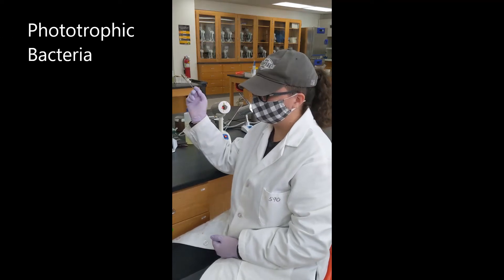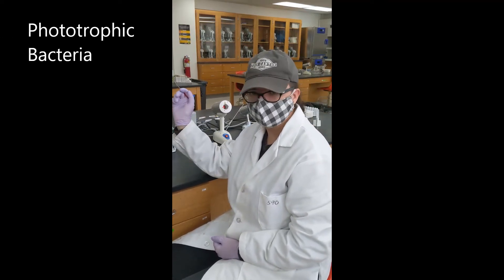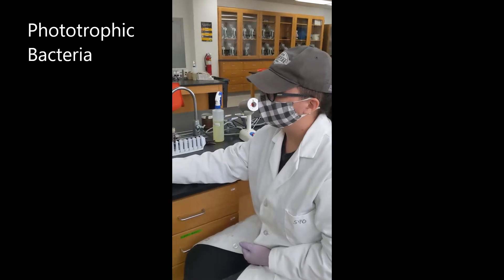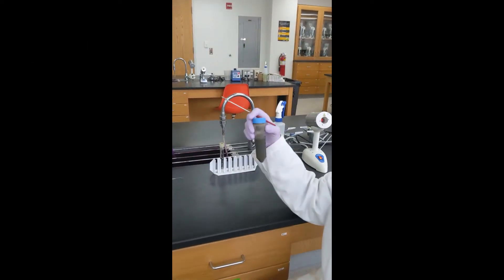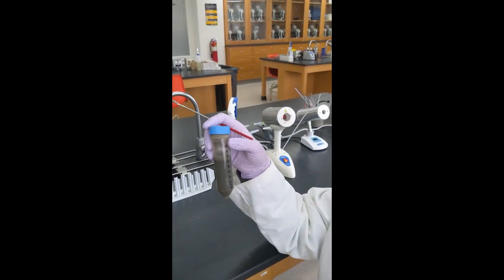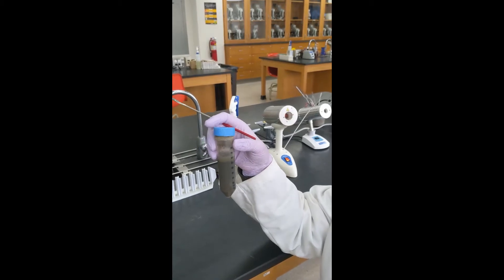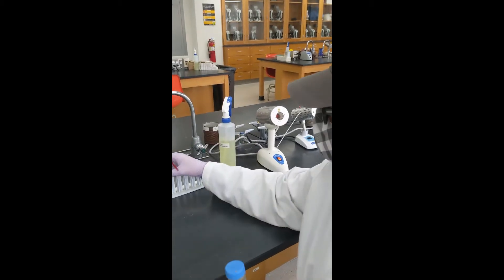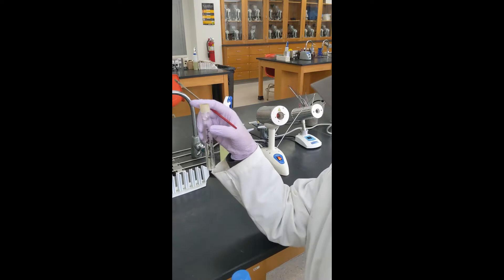All right, today we are going to be starting our phototrophic bacteria experiment. All we need for this is a tube of lake sediment or a soil sample and a tube of Omerod's media.